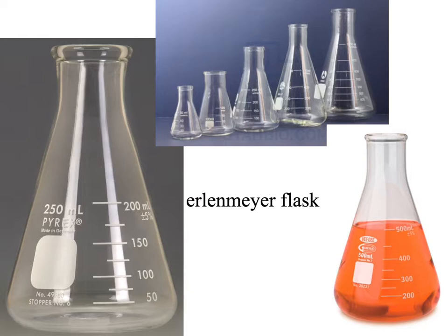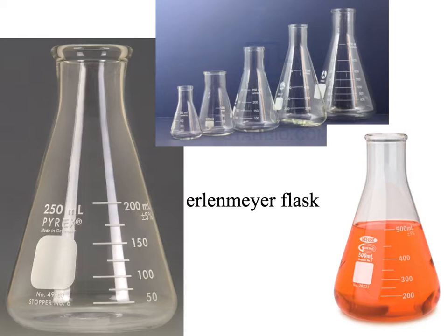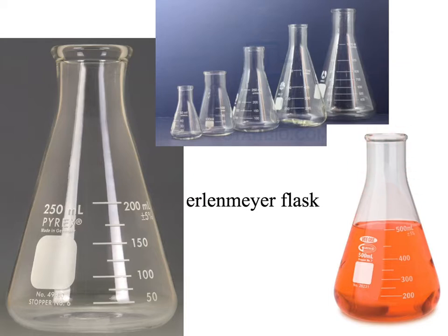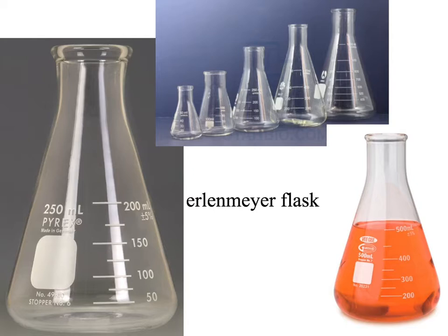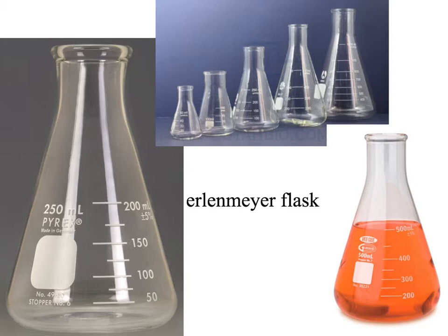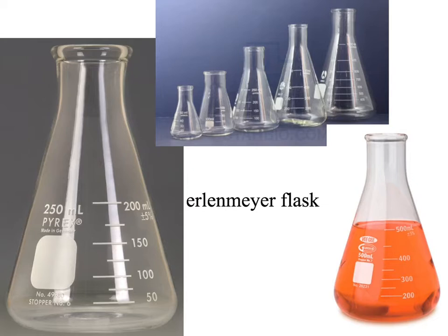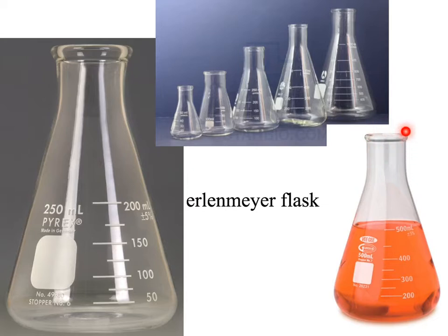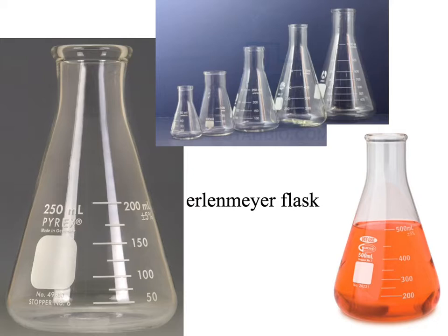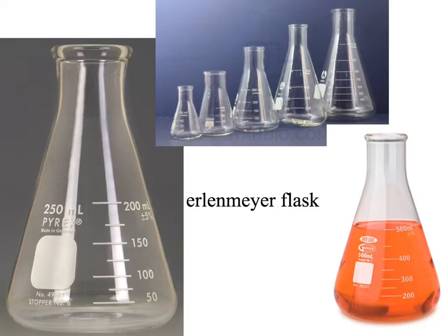The next piece of equipment is an Erlenmeyer flask. This is a type of flask that has this narrow mouth right here. Like beakers, they store liquid, but what makes them nice — why we'd use them instead of a beaker — is that they are easily sealable. On the quiz I'll expect you to say that they store liquid and they're easily sealable.